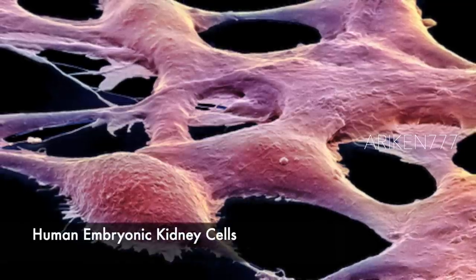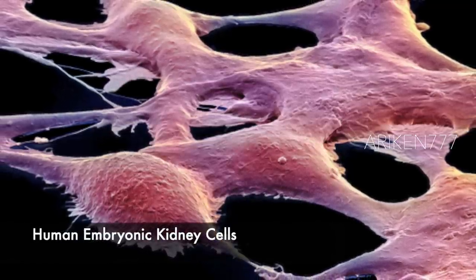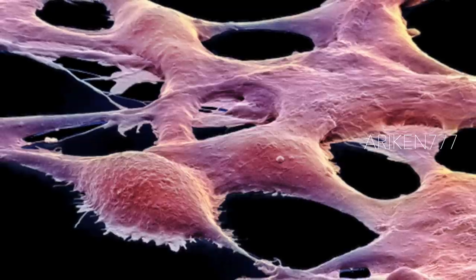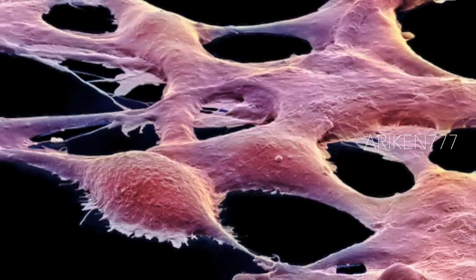These are human embryonic kidney cells. The cells are easy to work with in labs and so are widely used in biological research.